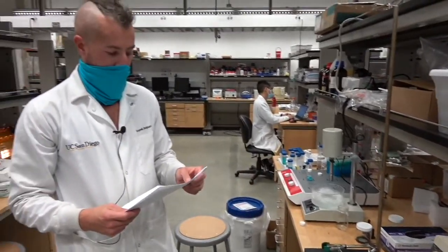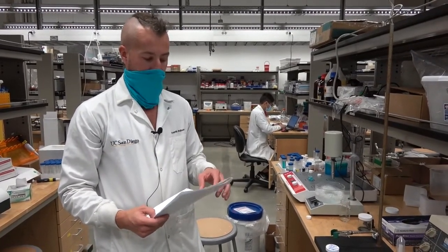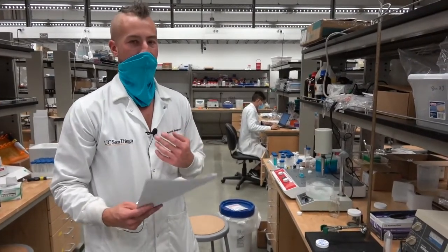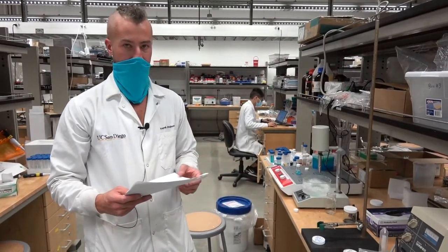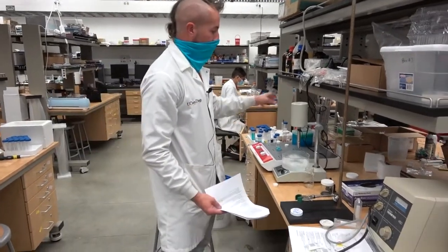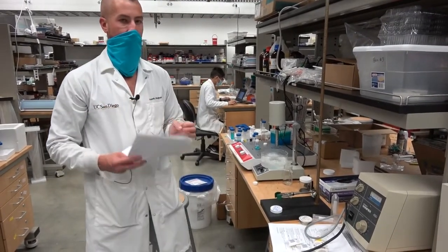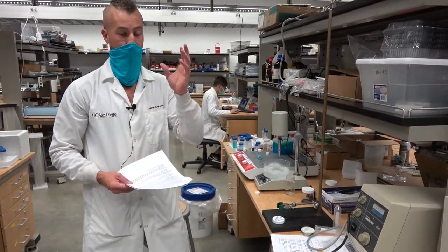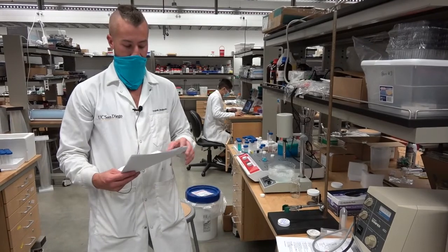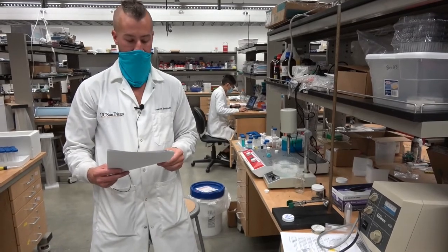So now as we move on to points 5.2 to 5.5, I'm not going to walk you through this because basically all it is is pipetting. And again, I don't think having you watch me pipette is going to be a particularly enriching experience for you. But what I do hope that you learned is some of the equipment that would have been accessible, including the lyophilizer upstairs. I also hope you learned some of the principles underlying the mathematics. So really go back and make sure that you understand what we're doing in loading capacity, loading efficiency, and on our drug release curve, okay?